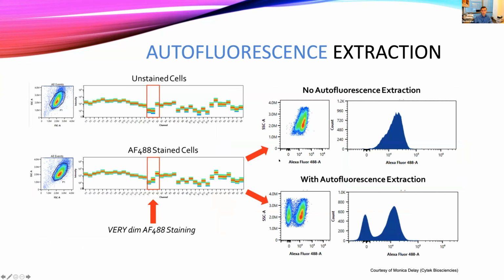And if we go to an example using the Aurora, this is just one of the cases where I believe this was an experiment with prime flow, where usually cells end up having a very high autofluorescence, and without autofluorescence extraction, where Alexa Fluor 488 in this case, we're adding the autofluorescence in this channel, so it's Alexa Fluor 488 plus autofluorescence. As you can see, it's very difficult to distinguish and to separate these two populations. Once we extract autofluorescence, sorry guys, I'm pressing the wrong button. When we extract autofluorescence, what ends up happening is that now we're just seeing Alexa Fluor 488 in the Alexa Fluor 488 channel, and the autofluorescence should be equal to 0 because we've extracted the autofluorescence completely from this fluorochrome.